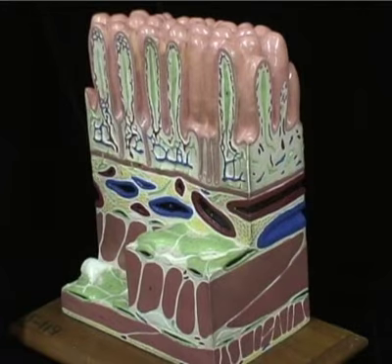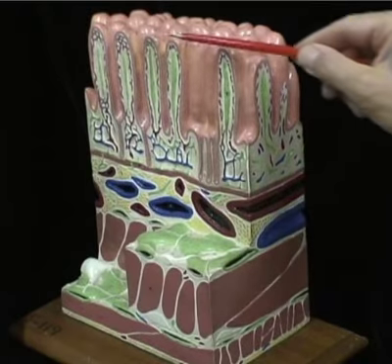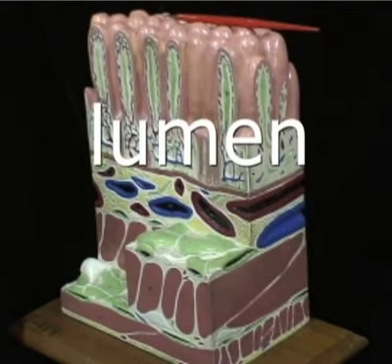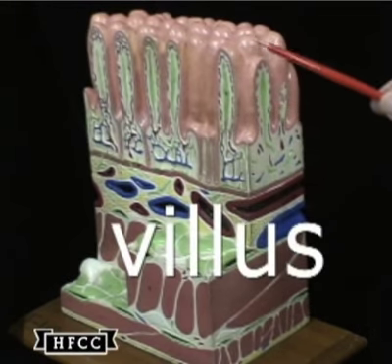The fourth and innermost layer is closest to the lumen, or where the food goes along, and that's the mucosal region, starting at the red line that I have the pointer going inward. I lay the pointer on the lumen. This is where the food will be moved across as it goes down the digestive system.